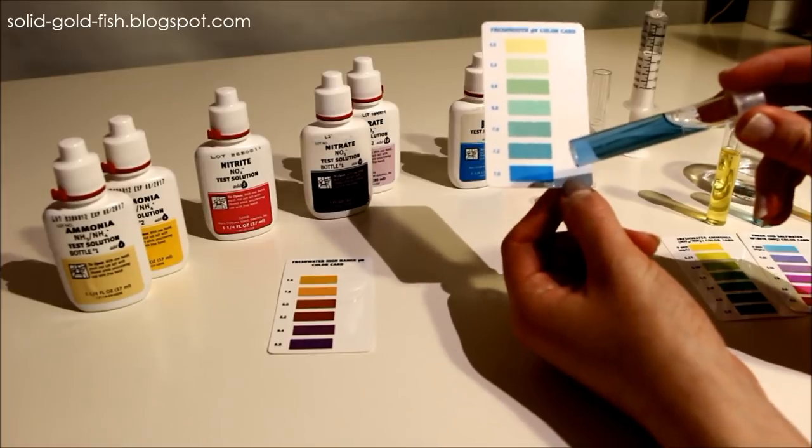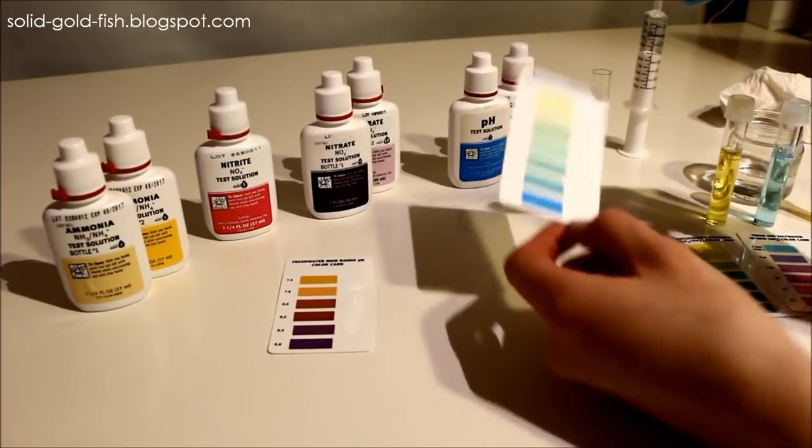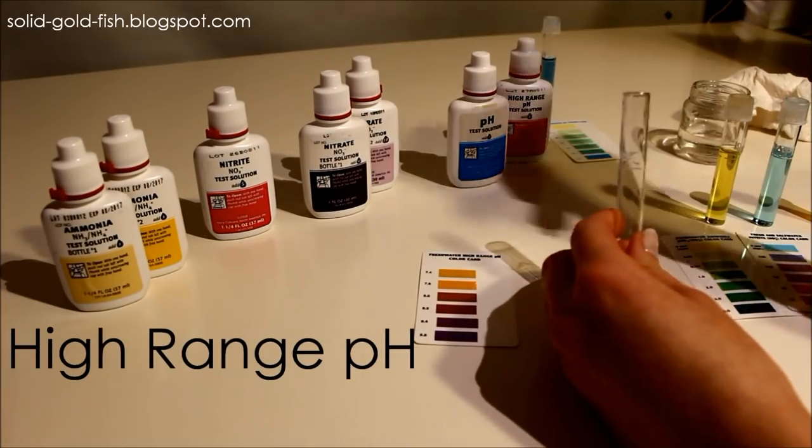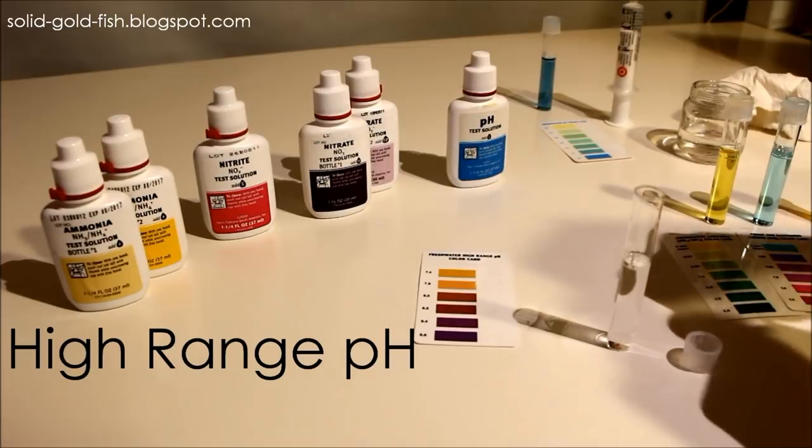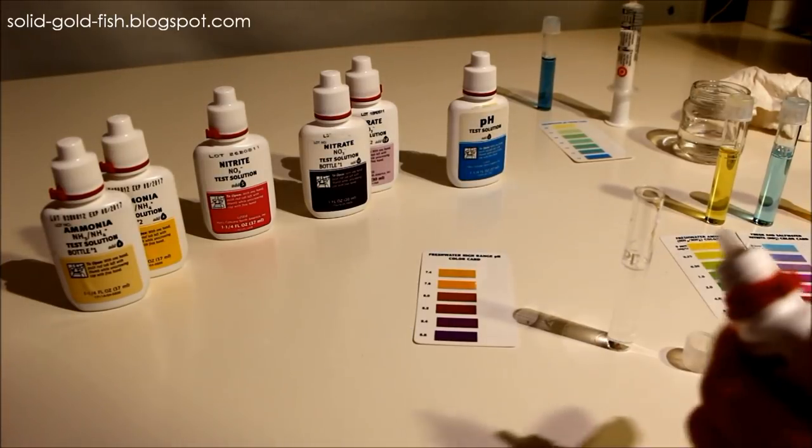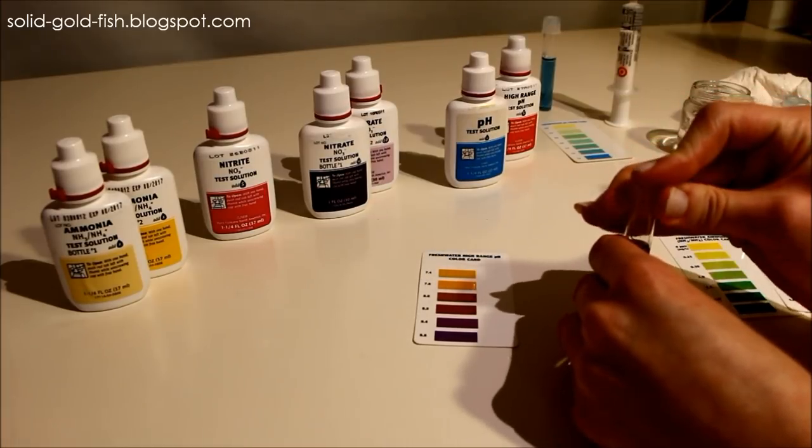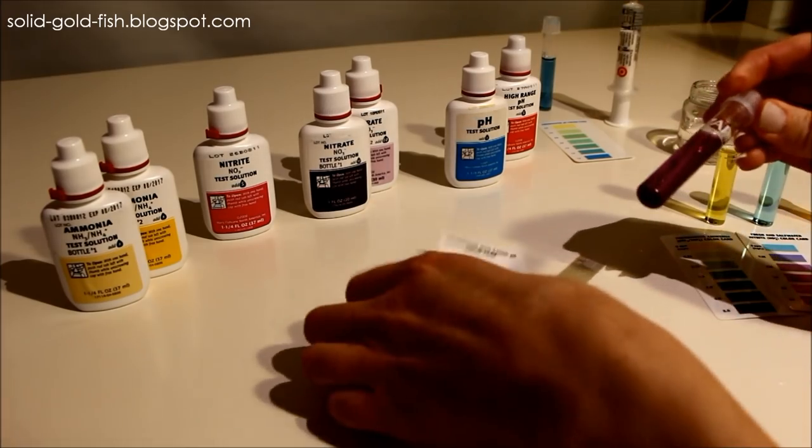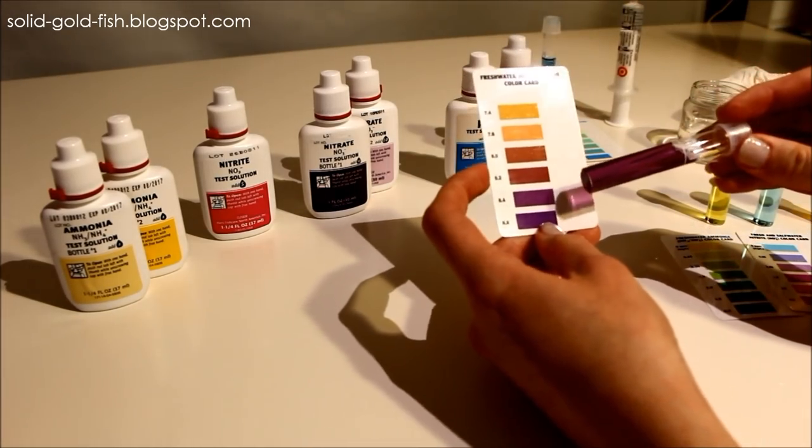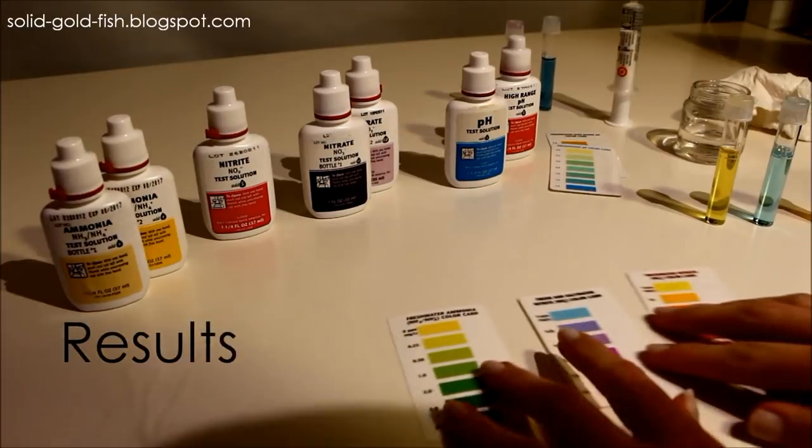Now I'm going to test with the high range pH test. This one is easy as well, you just add five drops and invert the bottle a few times to get it mixed evenly. My pH is reading at 8.4.